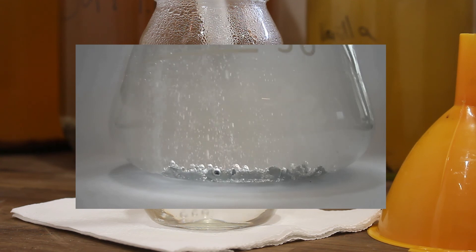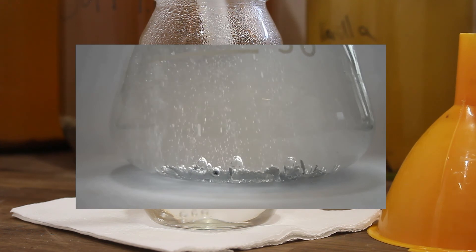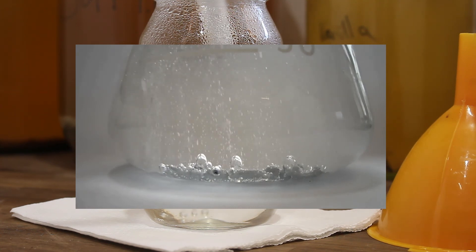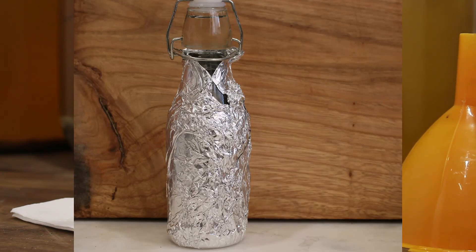If you are looking at using something like an alcohol, you can try and speed up the process by placing your preferably glass container somewhere mildly warm. When we say mildly warm, we are talking about something a little bit above room temperature, between 20 and 25 degrees Celsius. Make sure that it is covered in tin foil or something similar so light cannot penetrate. This is important. Light getting into this can cause breakdown of the aromatic compounds, remembering that they are volatile. This means that you can speed up the extraction by heating it, but you can also cause breakdown either from light or excess heat. This means you don't want to keep it too warm.